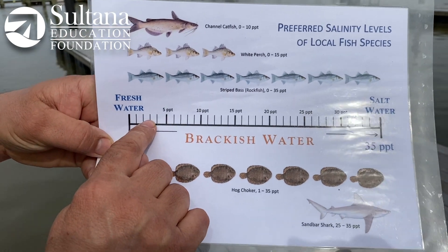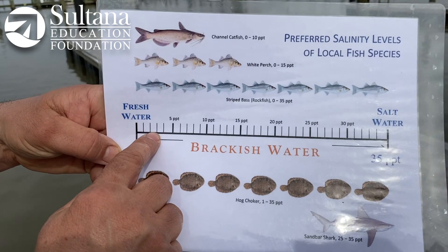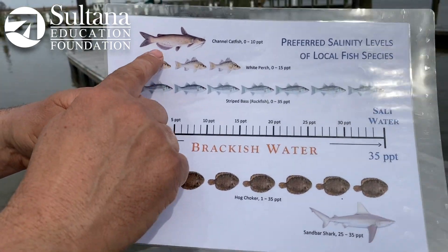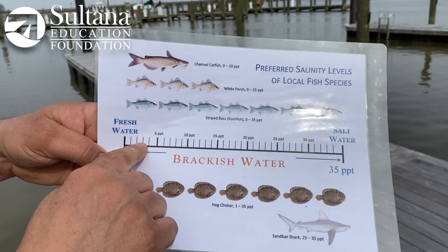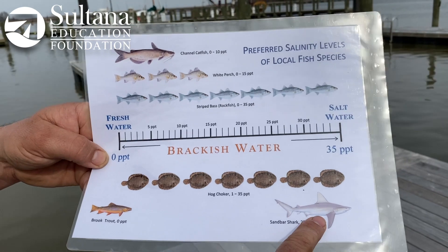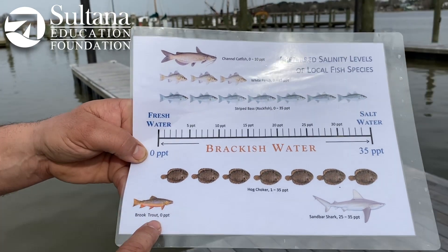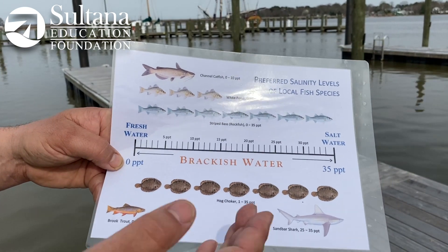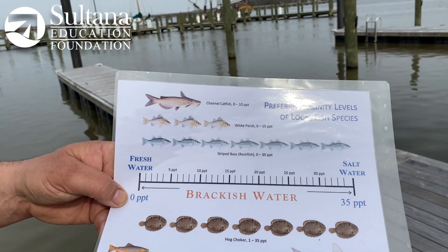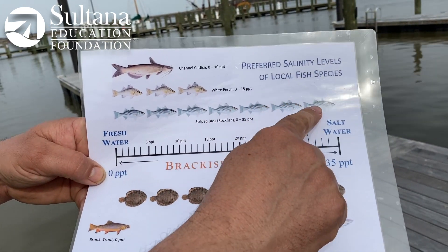Today our test measured three parts per thousand, so we're way towards the fresh end of the spectrum. The reason that's important is because different fish prefer different salinity levels. At three parts per thousand we're not going to see a sandbar shark — he likes a lot of salt in the water — and we're also not going to see a brook trout, which can only live in totally fresh water.